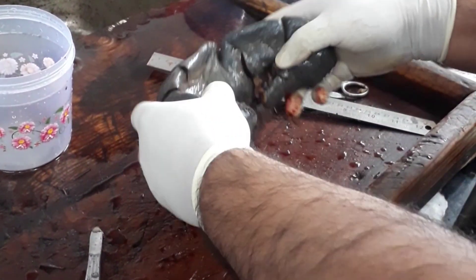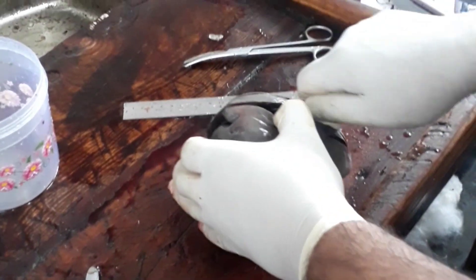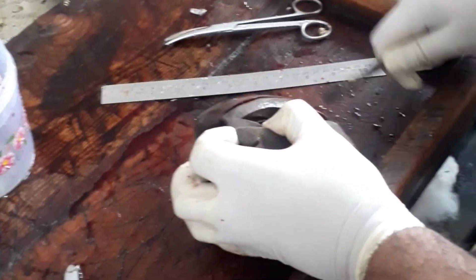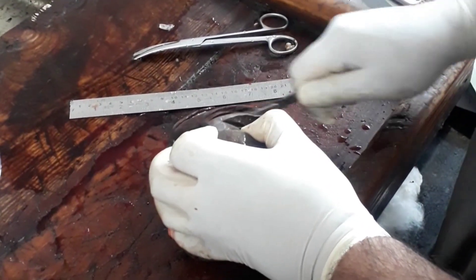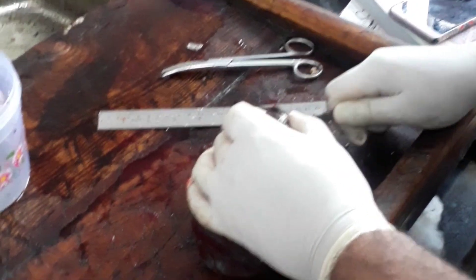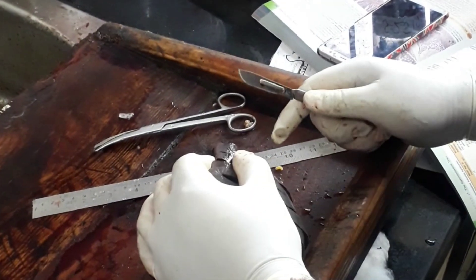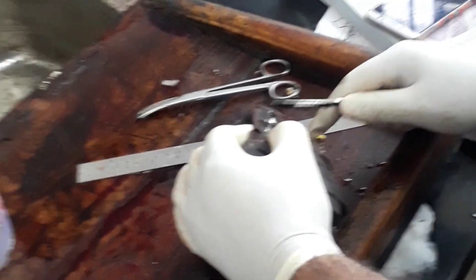Here, as you can see, the pathologist is sectioning the spleen in order to check if there is any significant area. As you can see in the display, there is some kind of a hemorrhagic appearance in the spleen.